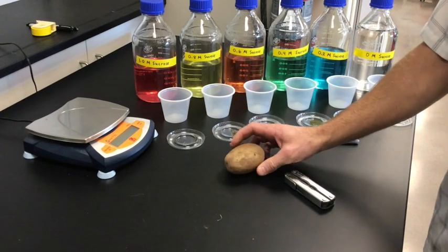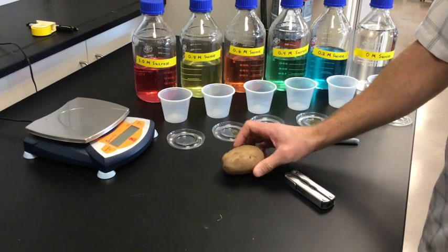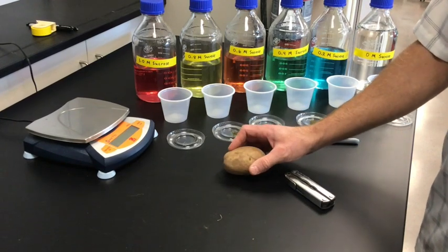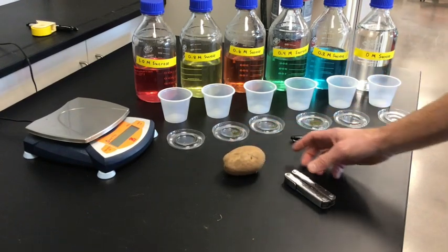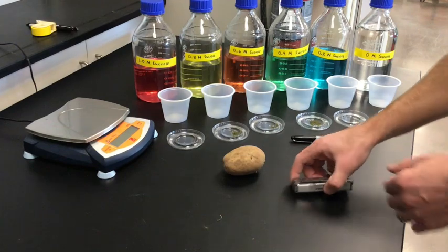So we're going to go ahead and cut this potato up into chunks and proceed with the procedure.